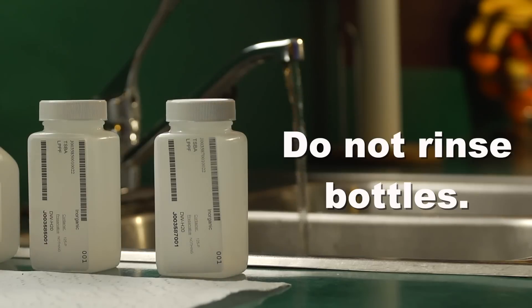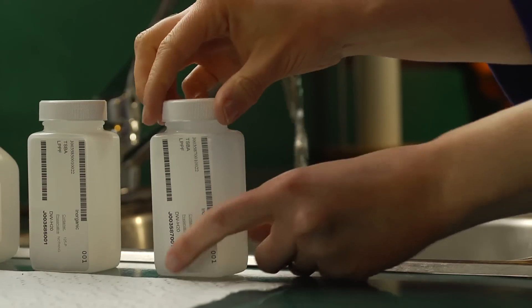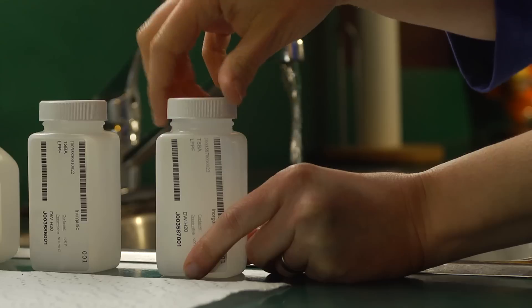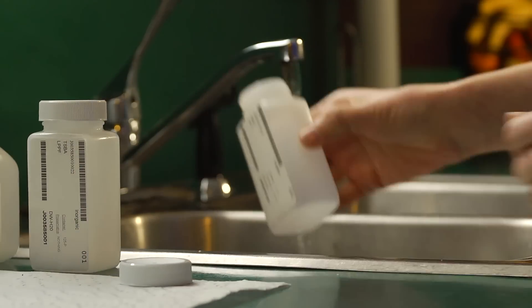It's important not to touch the insides of the caps or the bottles. If you have trouble holding the cap while you fill the bottle, set it rim down on the clean paper towel.